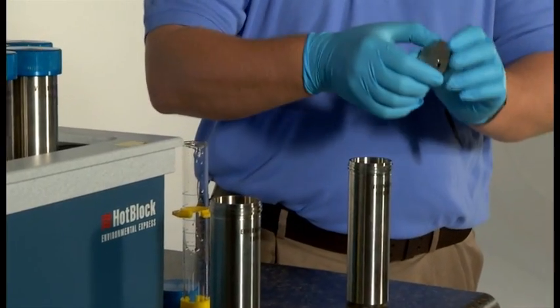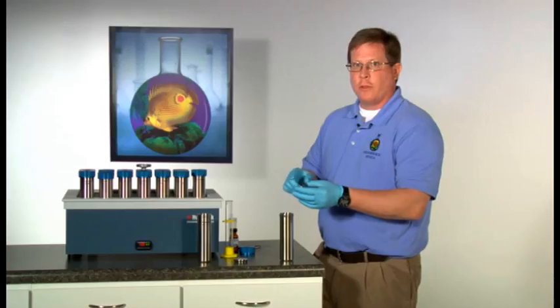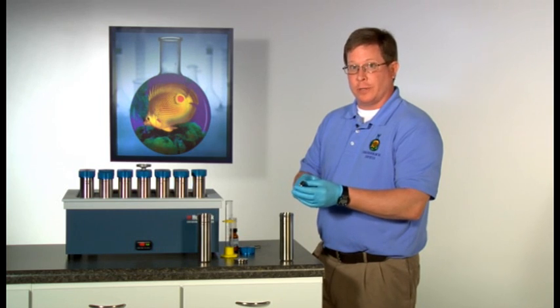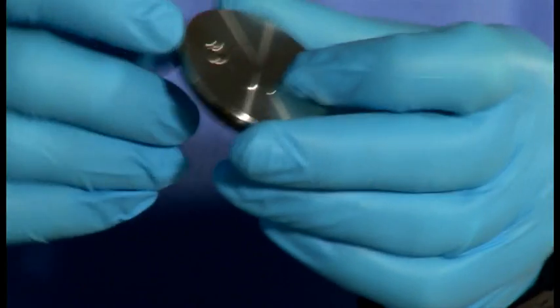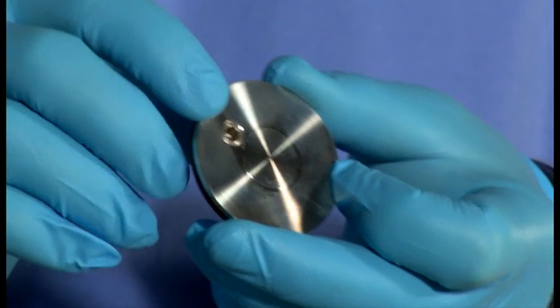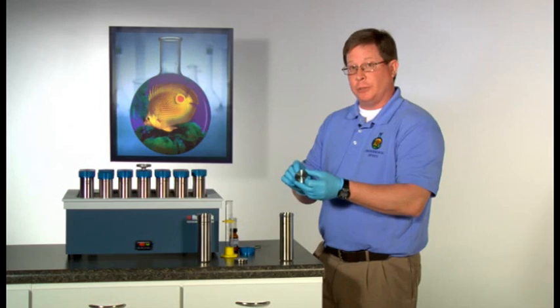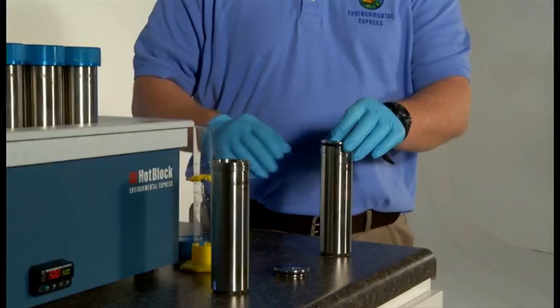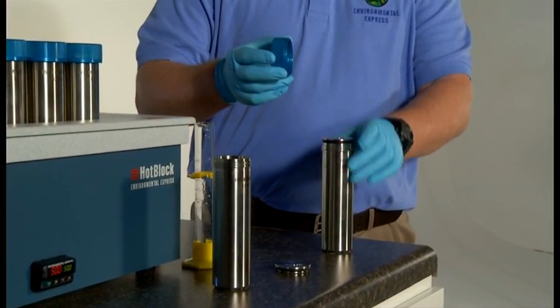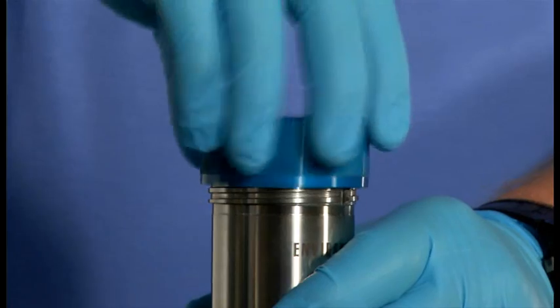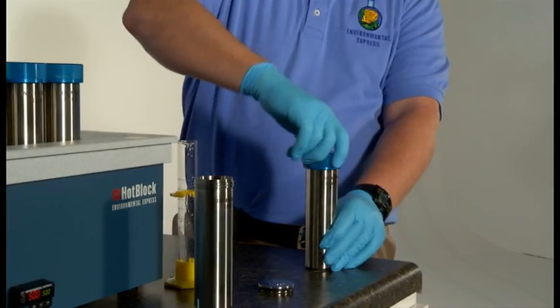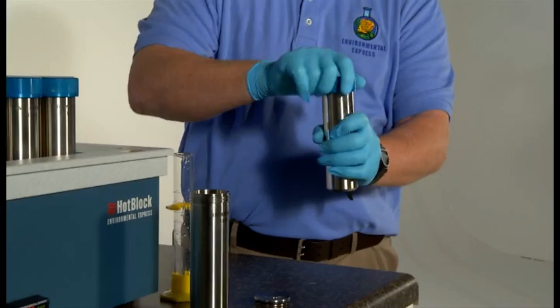Place the stainless steel inner lid on top of the soil cell. The O-ring provides the tight seal with the soil cell itself and the rupture seal provides a safety mechanism in case there's an unforeseen pressure increase due to an unknown in a sample. Hand tighten the threaded outer cap onto the cell. Ensure that it's nice and tight to provide a nice seal.